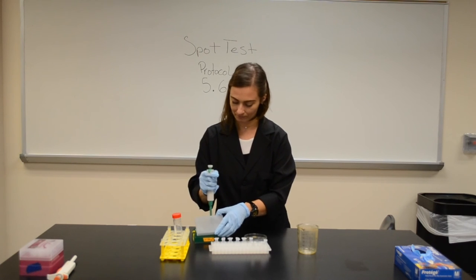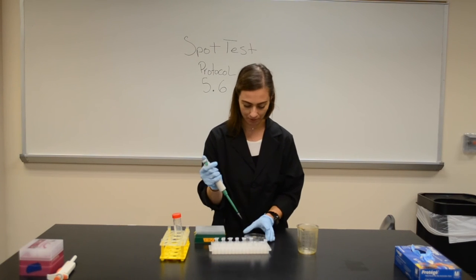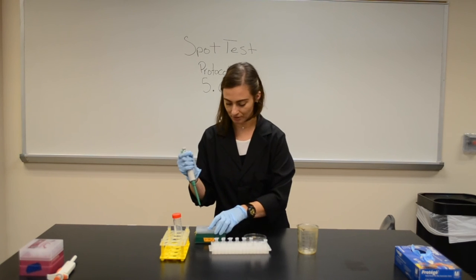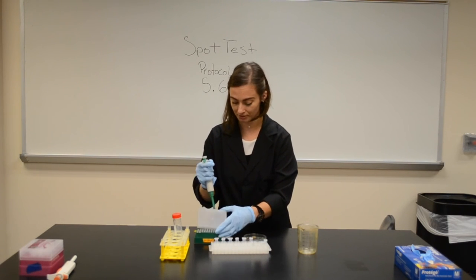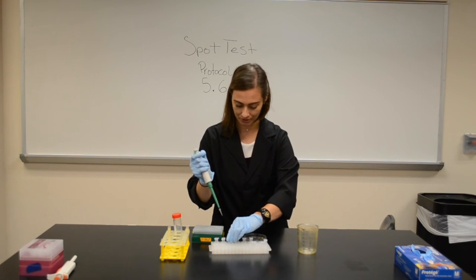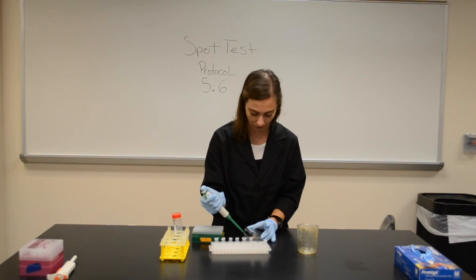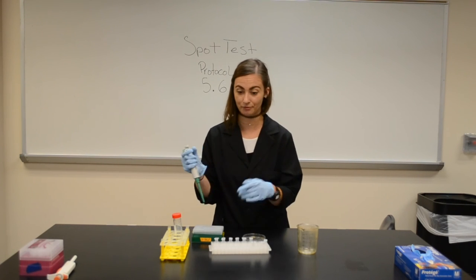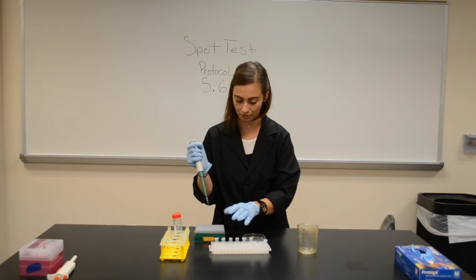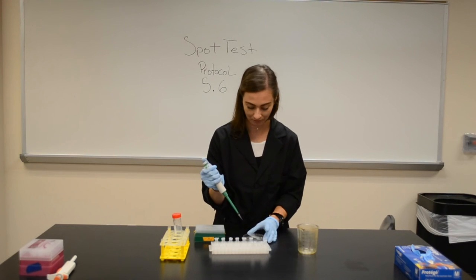You'll notice that most of these protocols are all about repetition. What you may be nervous about when you begin — by the time you've done two serial dilutions, you might feel really great about doing serial dilutions, plate assays, spot plates, or even learning to not talk while you're doing your work. Personally, for me, that's been the hardest: when someone's talking to you, knowing you can't respond or else you'll risk contaminating your work and having to begin completely from the beginning.